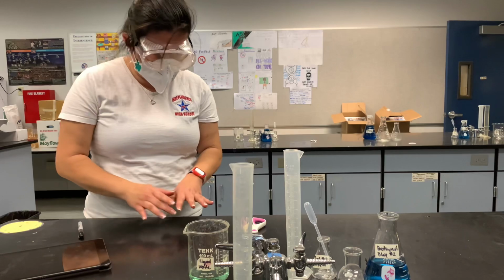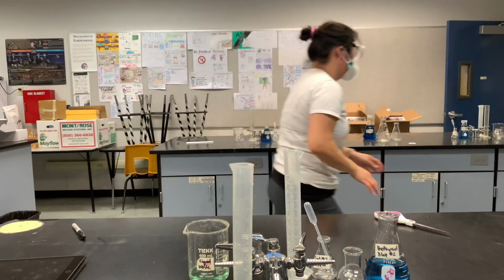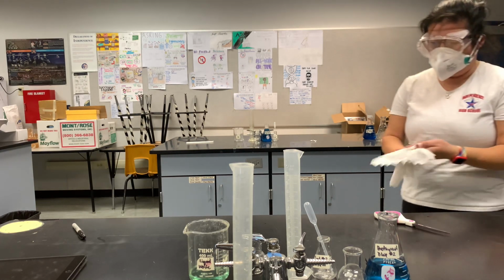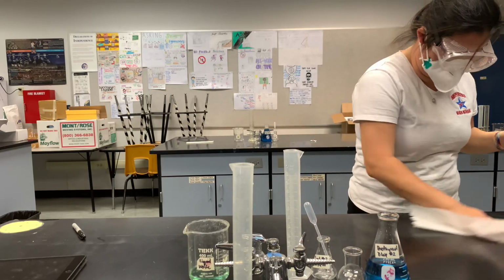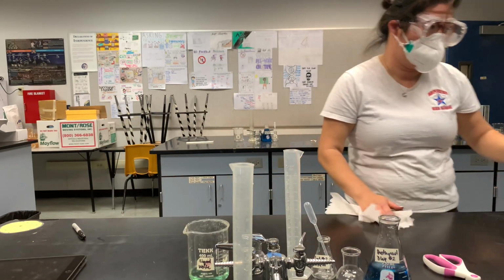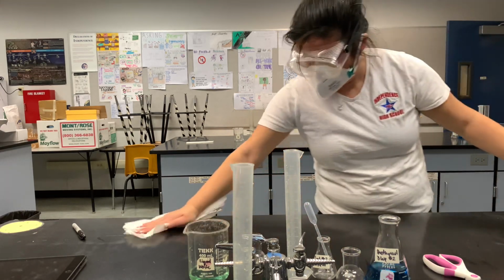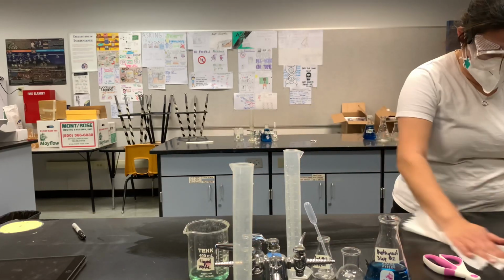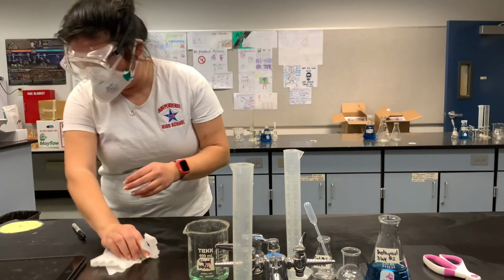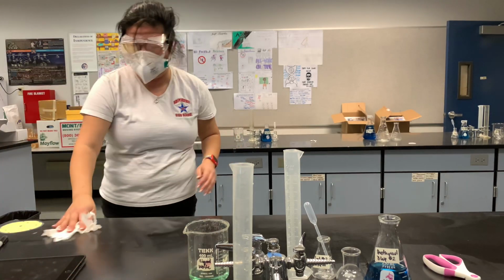Make sure this area, if you blow bubbles and there are little spots, all you do is grab a paper towel and wipe it down. Oh, we do have the spray bottles, so we have cleaning solution. And once you're clean, you're going to go and wash your hands, okay? That's it.